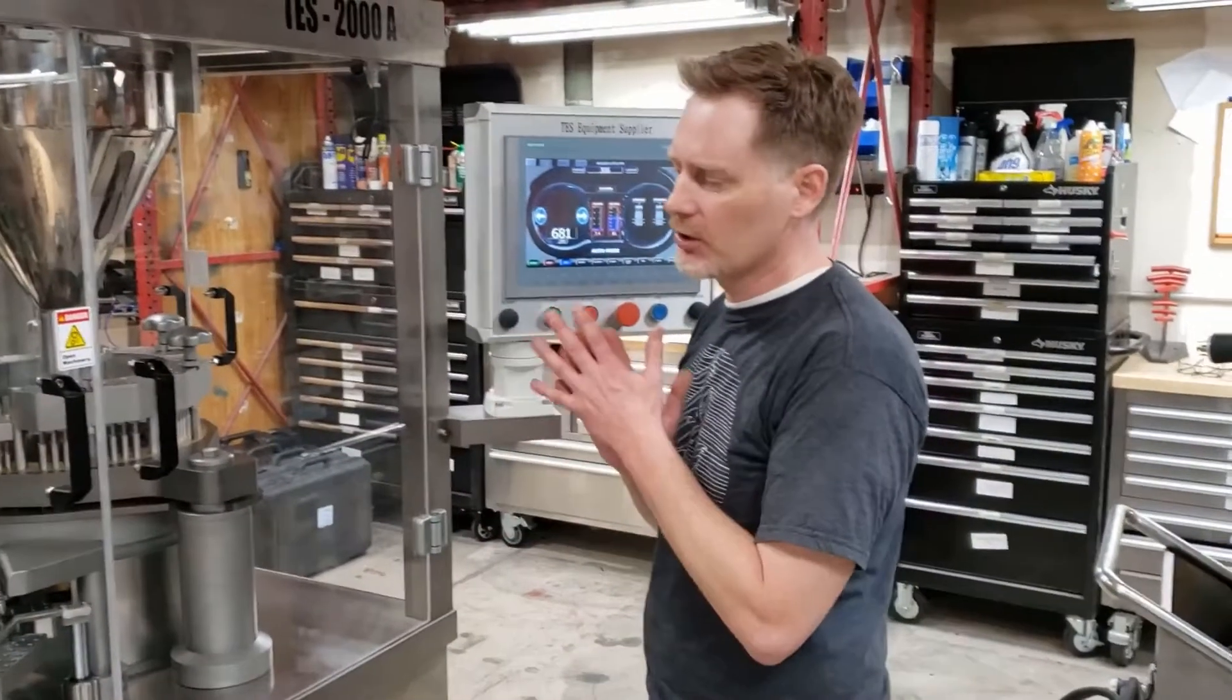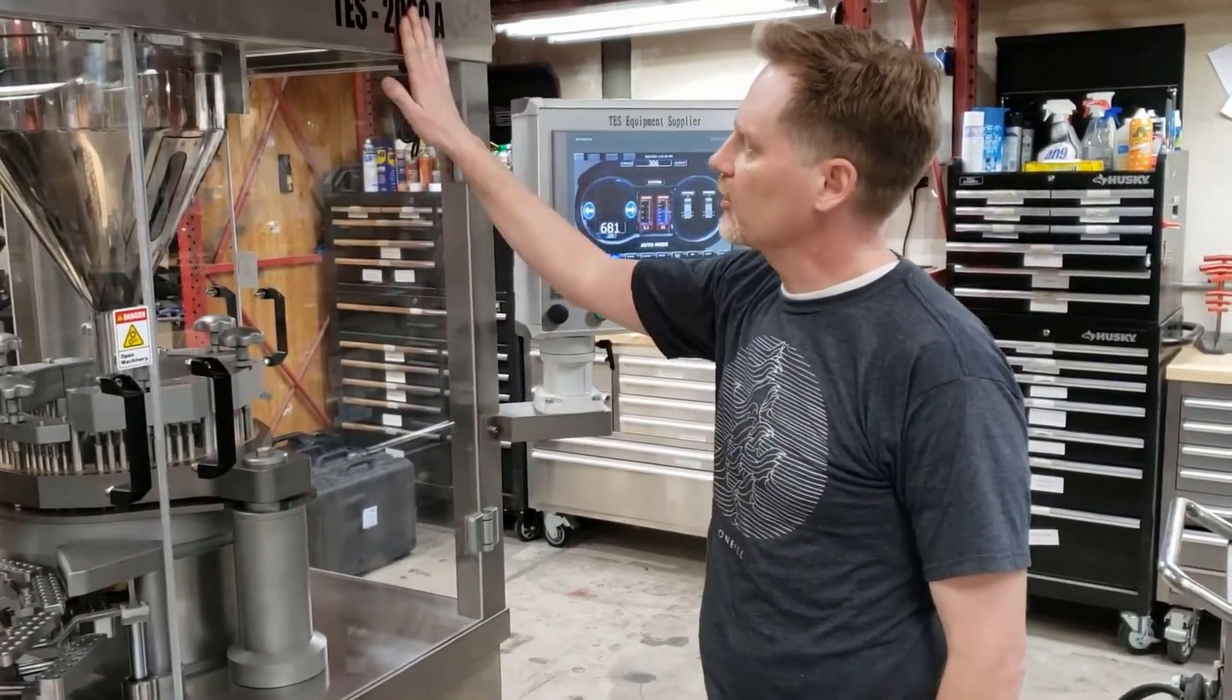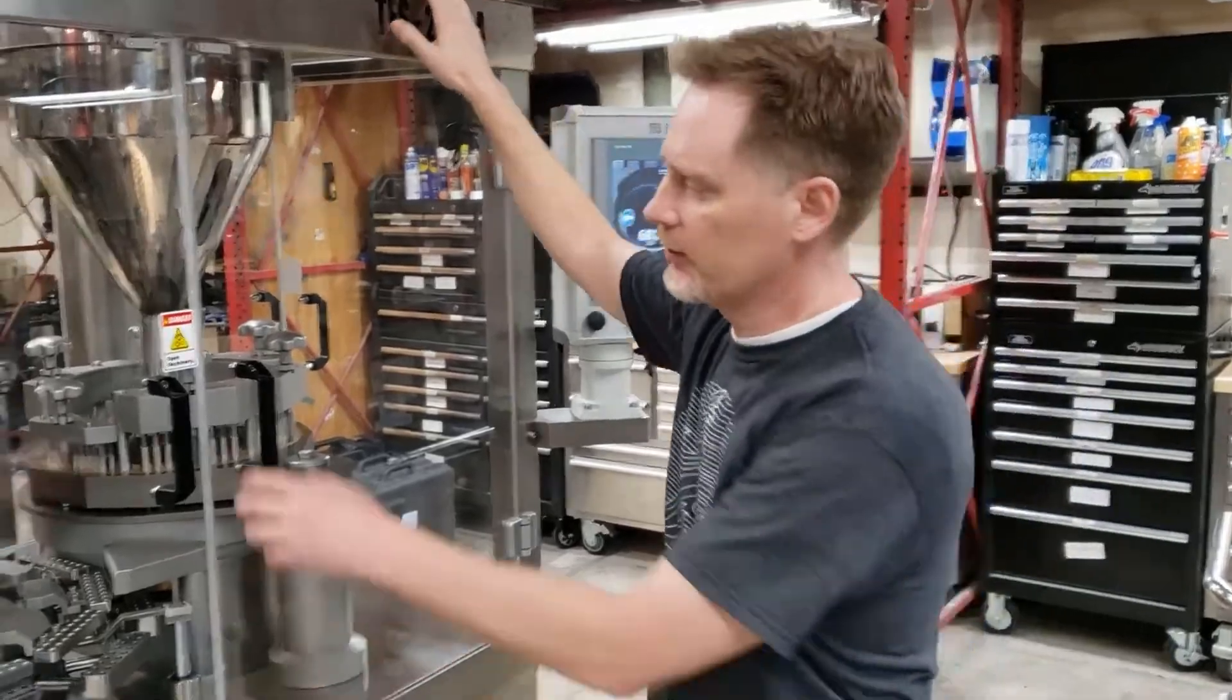So today we're just going to go over a basic machine overview of how capsule fillers work. So again, this is on a 2000 machine, but on any of our capsule fillers it's going to be basically the same.